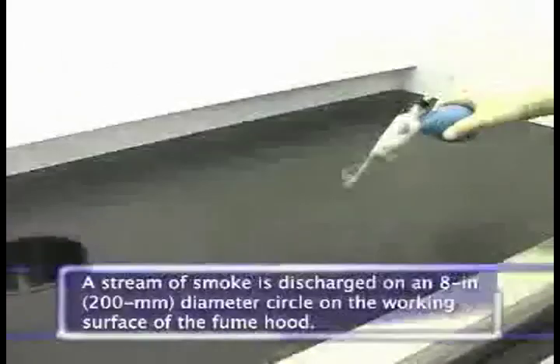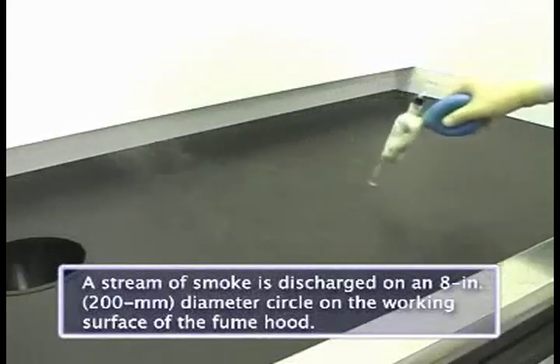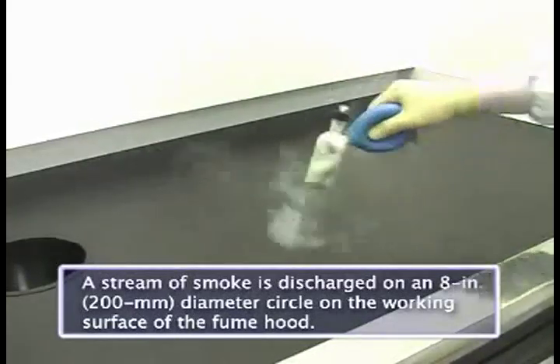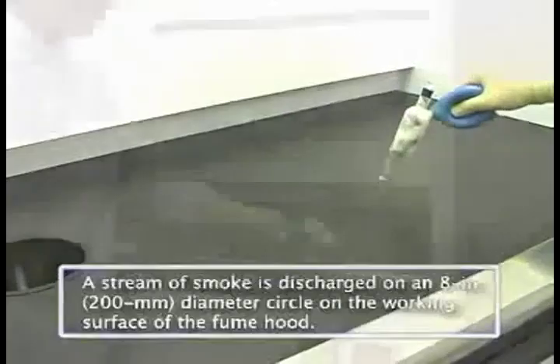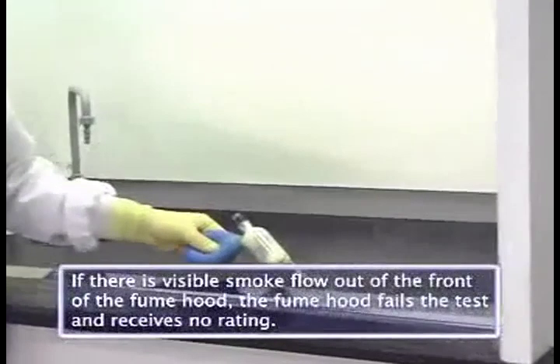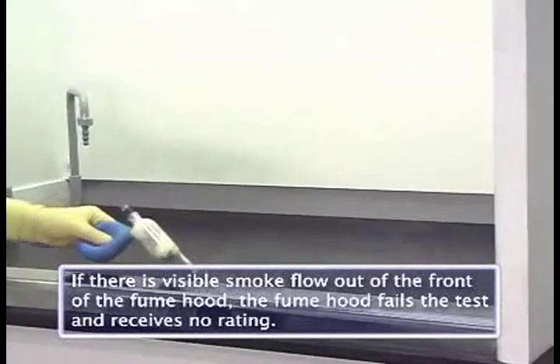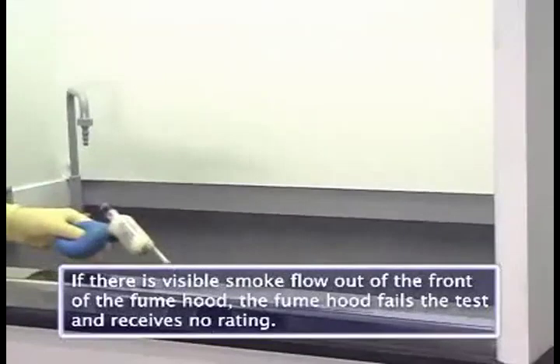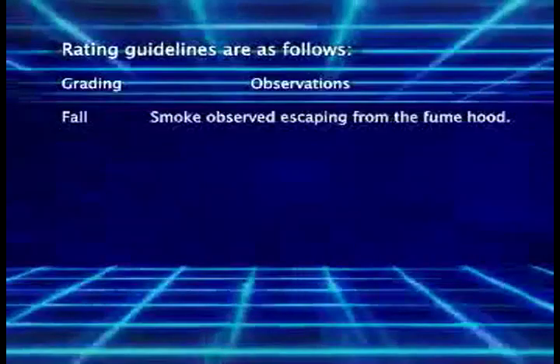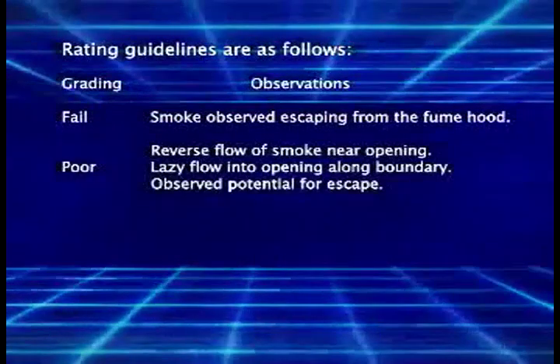Next, a stream of smoke is discharged in a circle on the work surface of the fume hood. Depending on the observations taken during the test, the fume hood is given one of the following ratings.